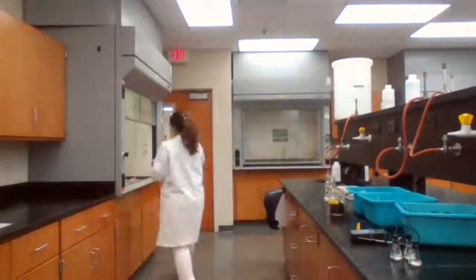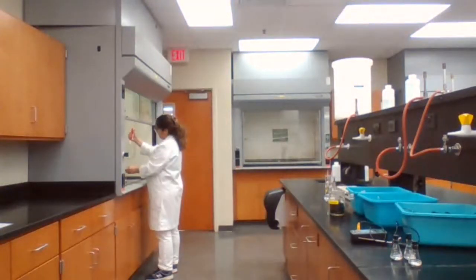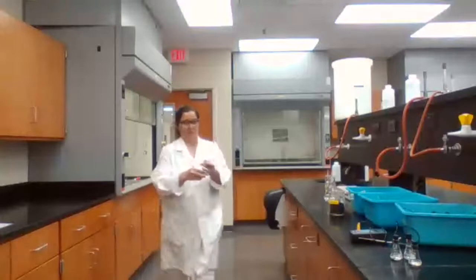Going to bring 10 milliliters of the sample. Equals 43.171.